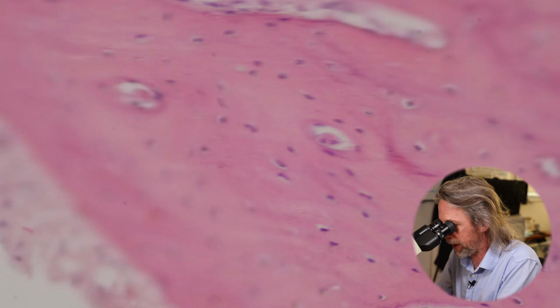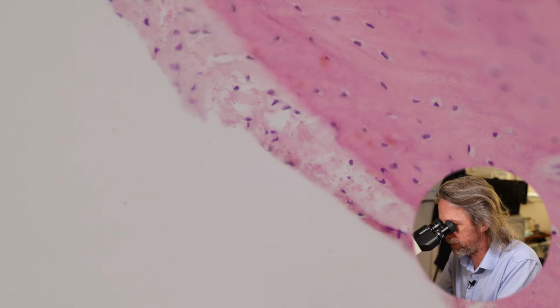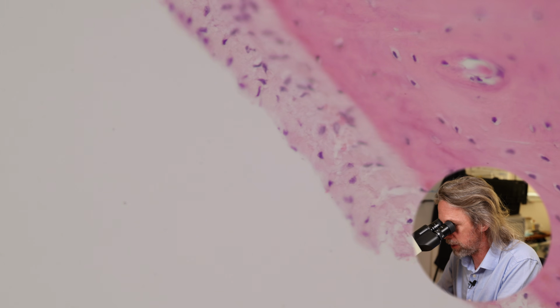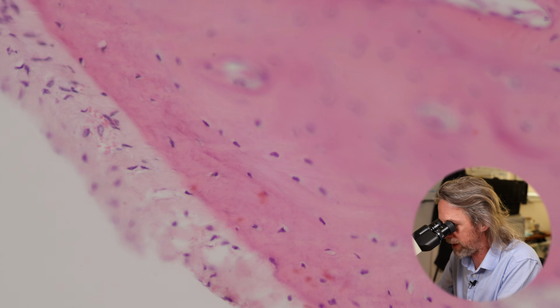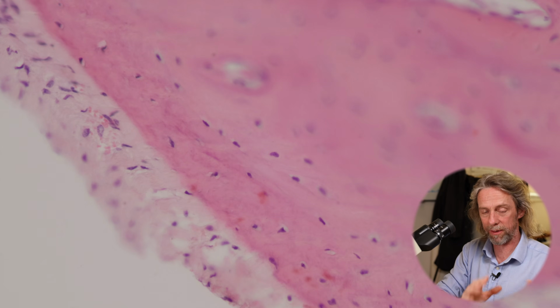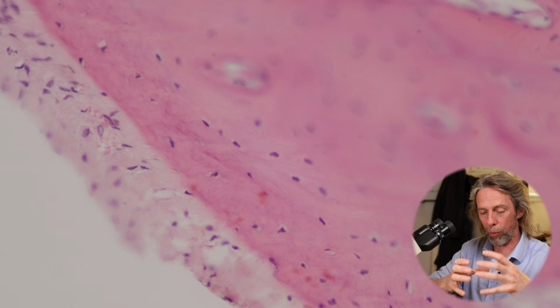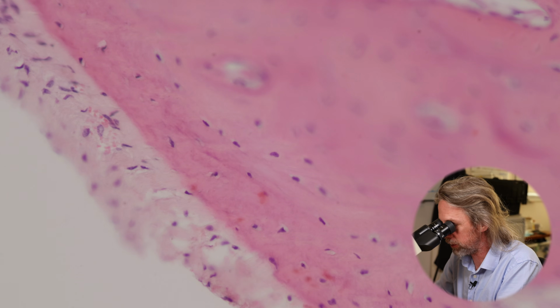Okay. Let's go there now. Right. So on the surface, that's pretty good. It's a bit folded there, but okay. So periosteum covers the bone, and then we slide into the bone. You can actually see there's a bit of a special layer up against the periosteum, and we'll see when we look at the other stain how there are particular layers there, kind of reinforcing the outermost part of the bone, and the periosteum is tied into that with collagen fibres.